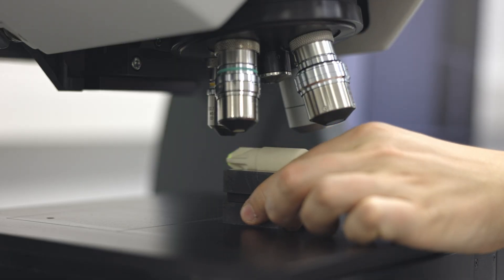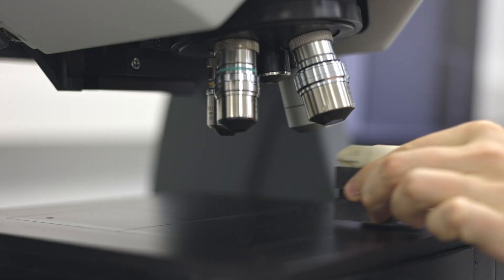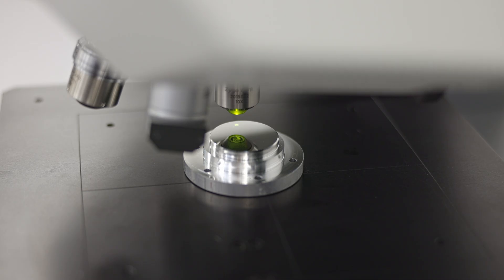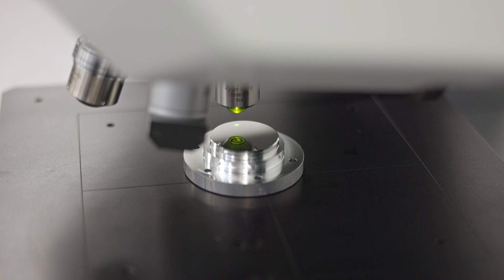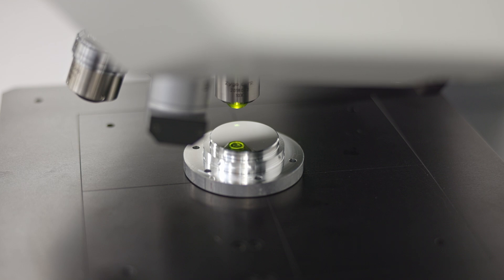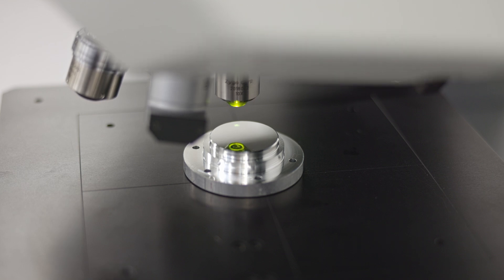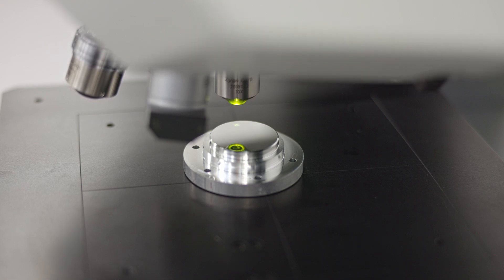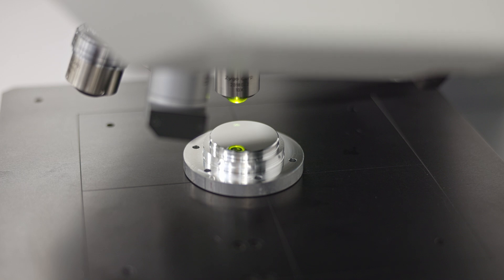For our next part, we're going to take a look at a diamond-turned piece of aluminum made on a German manufacturer diamond lathe. I did this piece about two years ago and have so far missed equipment that can reliably measure something this specular and smooth. The workflow is pretty identical.